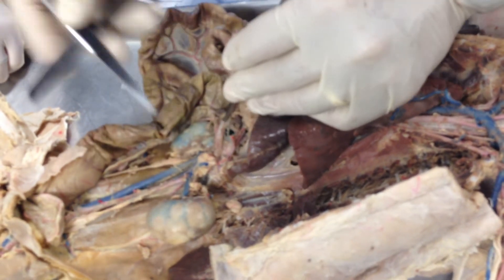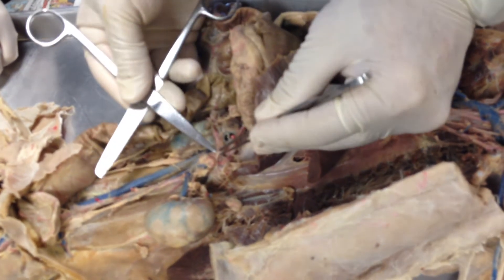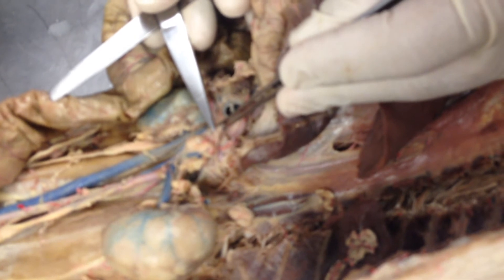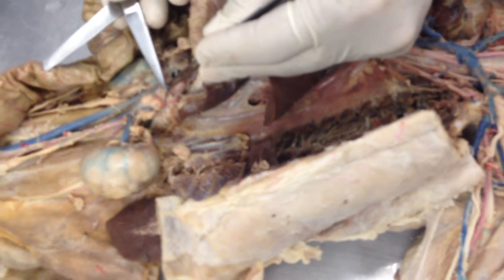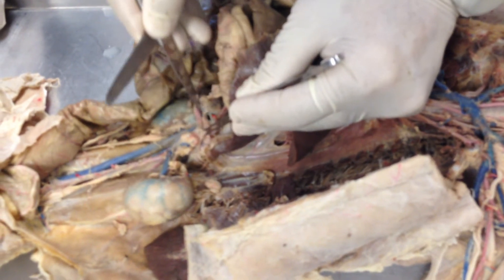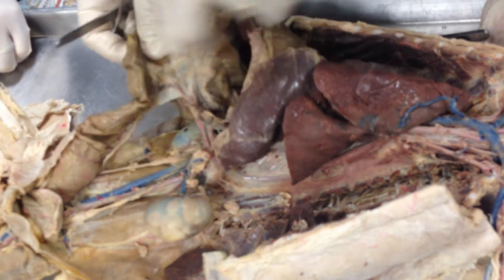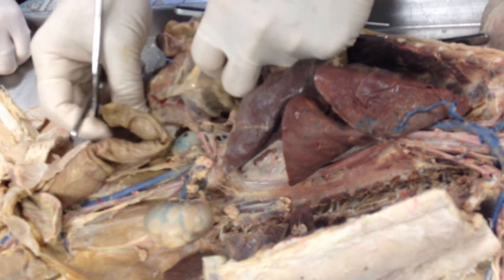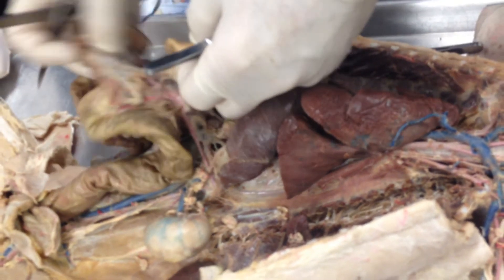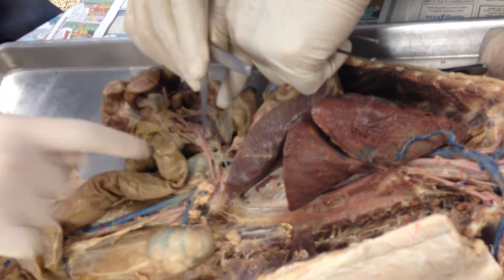The second major branch is the superior mesenteric artery. Notice all of this cream-colored material — those are all sympathetic nerve fibers. That little nodule that looks like a sesame seed right there is the celiac plexus, which we discussed in Chapter 16 with the sympathetic nerves. So: celiac artery, celiac plexus, superior mesenteric artery, and all of the sympathetic nerves. The superior mesenteric artery runs into the small intestine, and all of those branches are the branches of the superior mesenteric artery — you can actually see the sympathetic nerves running against it.